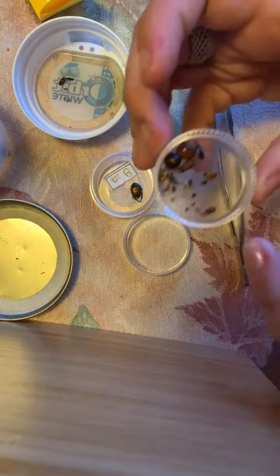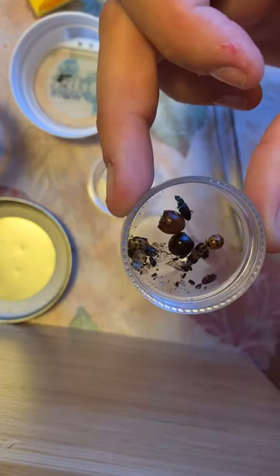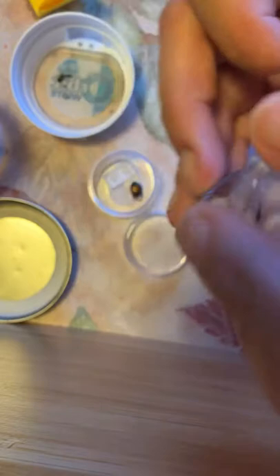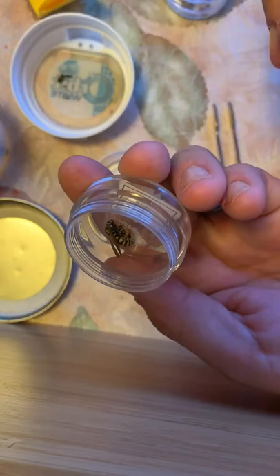I brought in a couple of different ladybug varieties we had found at Loyola Beach in Chicago — there's this Mexican ladybug, and then two larger ones whose heads came off, so they were not selected. There's also a ground beetle that was not selected. One young lady wanted to do a wasp, then Inez got the same idea, so the wasp is represented here too.